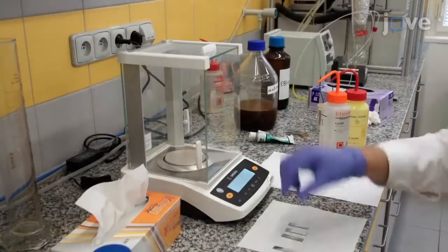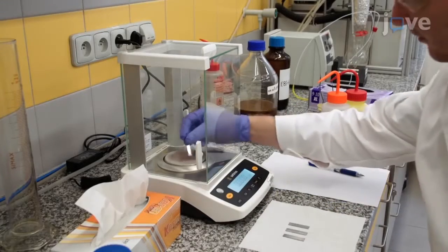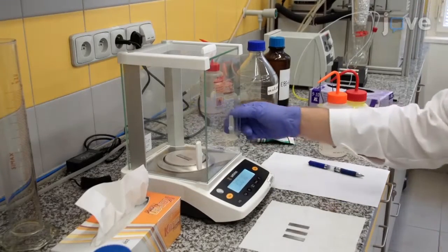After drying, weigh the sample on an analytical balance to an accuracy of four decimal places.